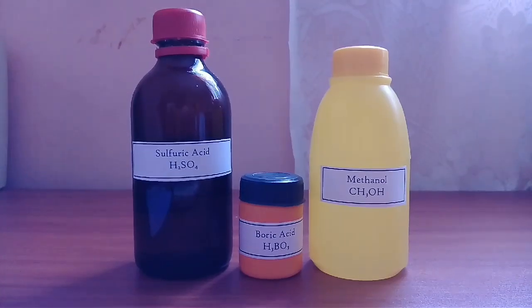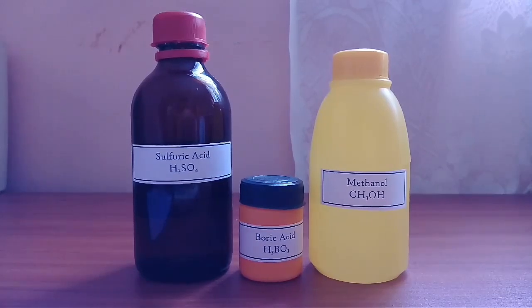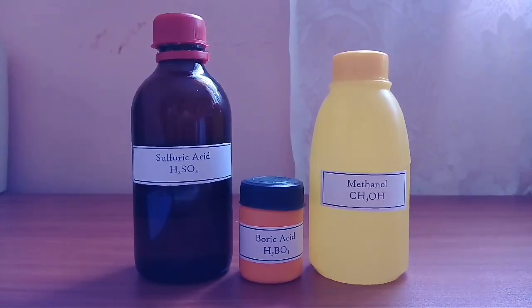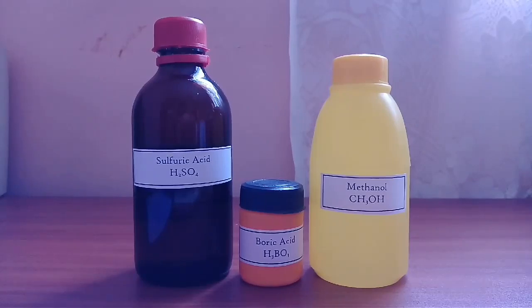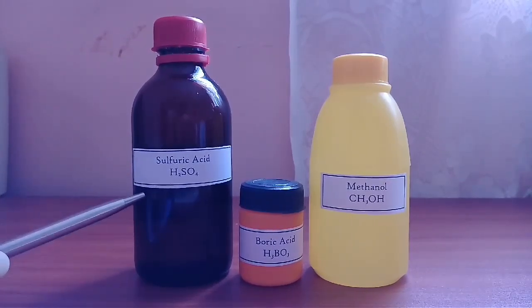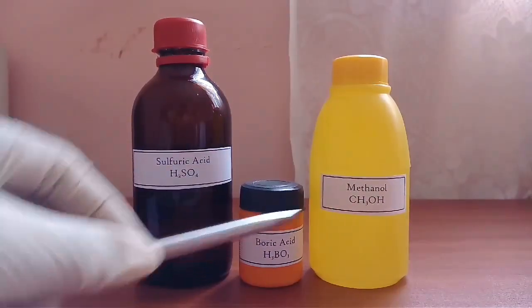Safety is number one. Warning: sulfuric acid is very corrosive. Methanol is highly flammable. First, we need sulfuric acid, boric acid, and methanol.